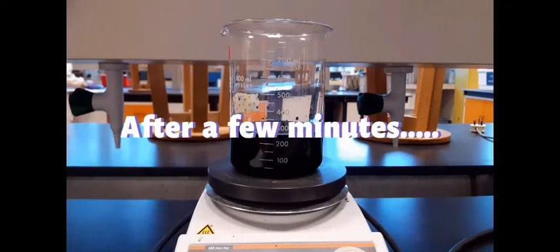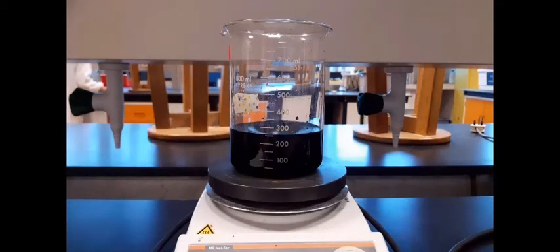The addition of potassium permanganate solution is finally completed, and after this we shall wait for a few minutes before we add another solution of sodium acetate trihydrate. This time the addition has to be done in small amounts, just like when we added potassium permanganate.